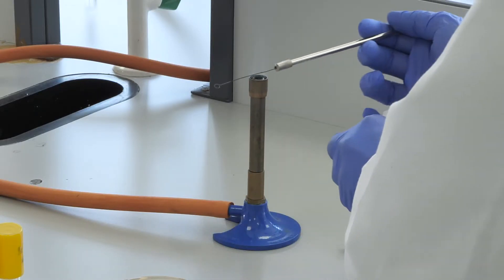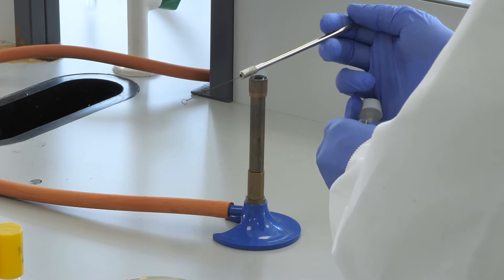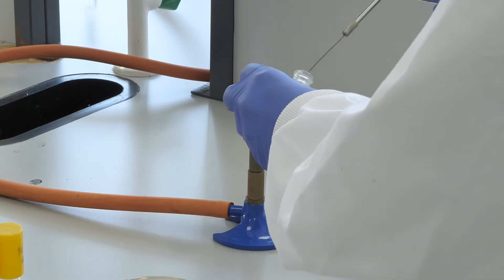Gently stab each with a loopful of culture using aseptic technique.